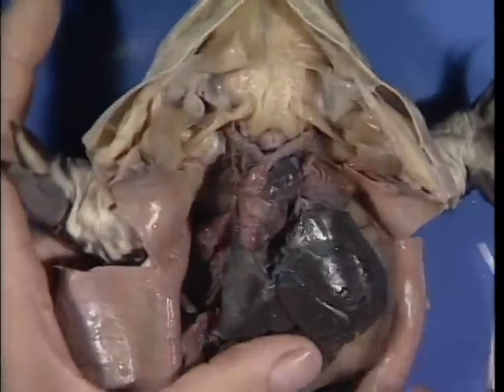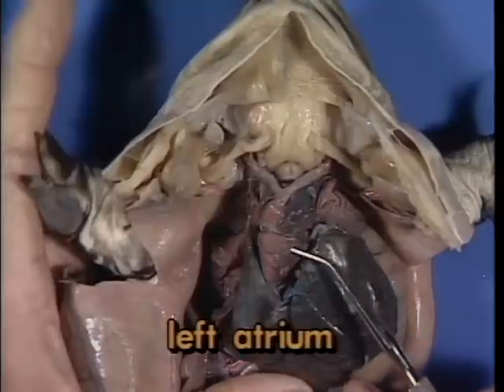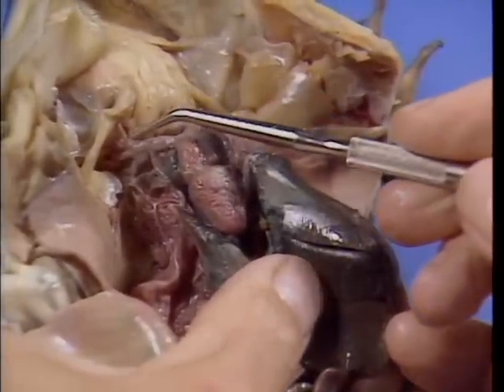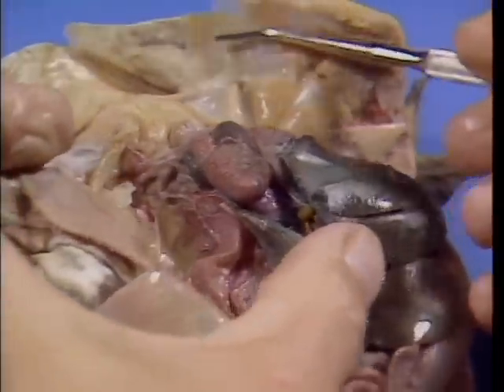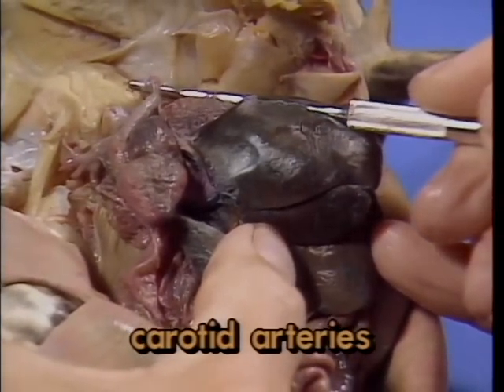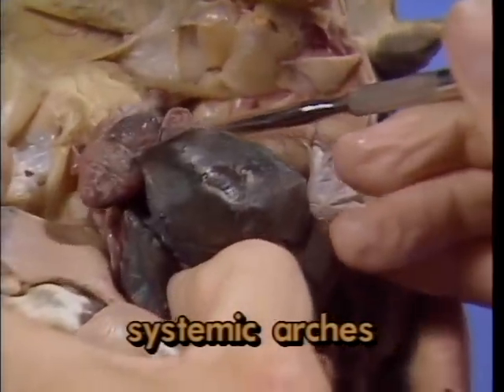Once oxygenated in the capillary beds of the lungs, the blood returns to the heart through the left atrium, again descending into the ventricle. This time, blood exits through additional vessels which branch off the right and left truncus arteriosus to supply oxygenated blood to the head region through the carotid arteries, here and here, or to the rest of the body through the systemic arches, here and here.